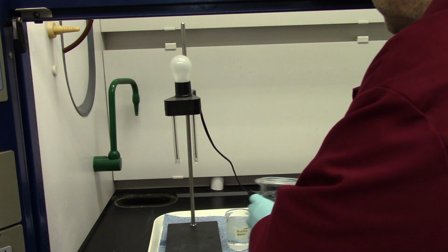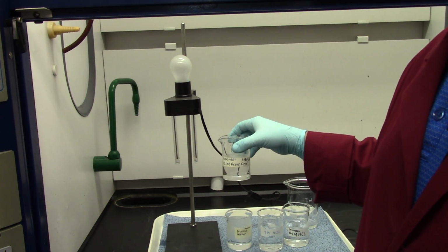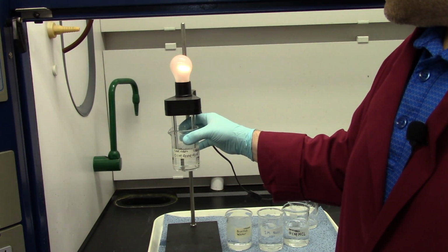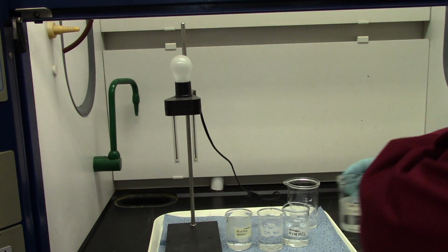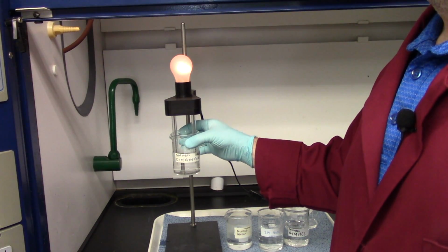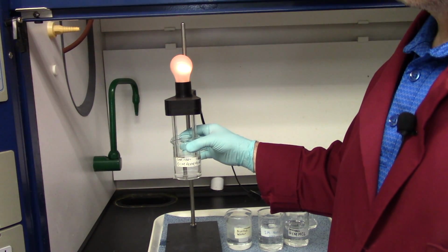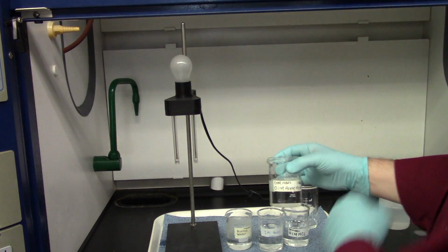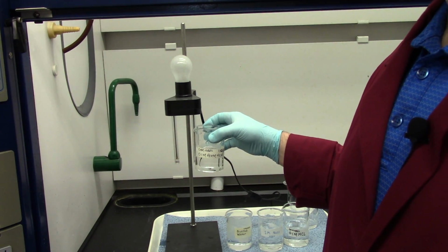There we go. And finally, acetic acid, the flavorful ingredient in white vinegar. Boom. Now, I don't know if you can see this on the camera. That light is definitely coming on. Let me turn this light off here, see if it helps. See if you can see it. That light is definitely coming on, but it comes on very, very faintly. I hope it's coming out in the video, guys, this light is just barely glowing. So this is indeed an electrolyte, but it's a weak electrolyte because it doesn't conduct electricity very well.